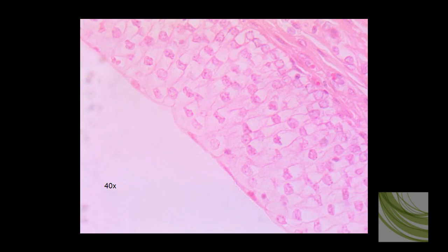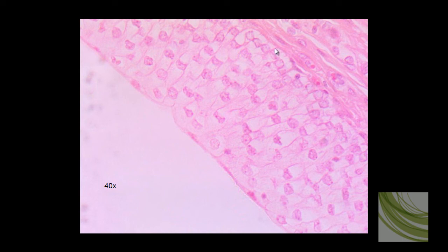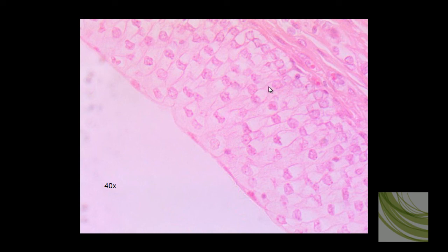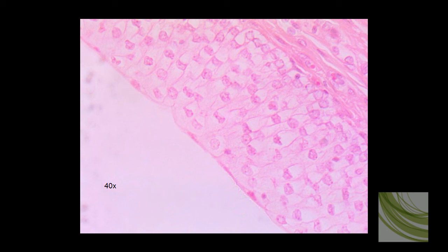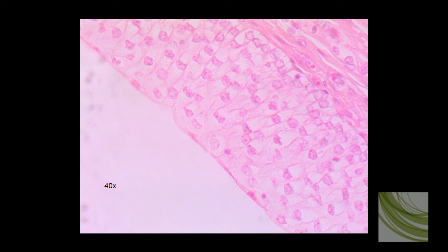And here is that slide using the 40X objective — the highest magnification we'll go. We can see the basement membrane along here. We can see some lamina propria underneath it. And all of these little overlapping cells are transitional epithelial cells. I'm going to outline some of the cells here for you — here are some different individual transitional epithelial cells.